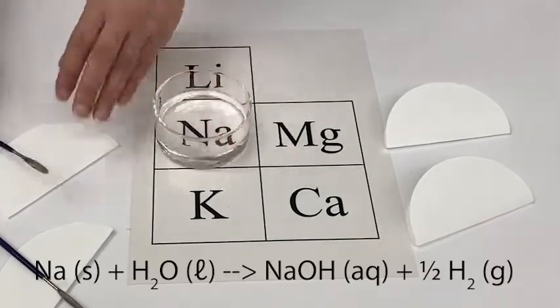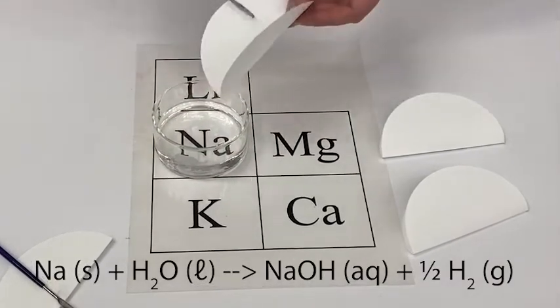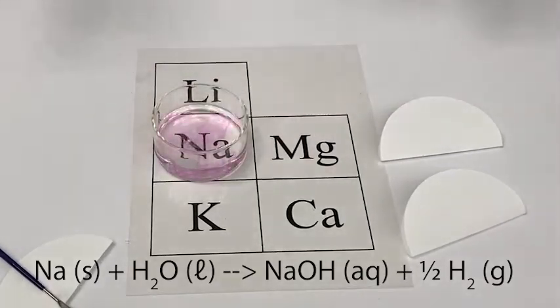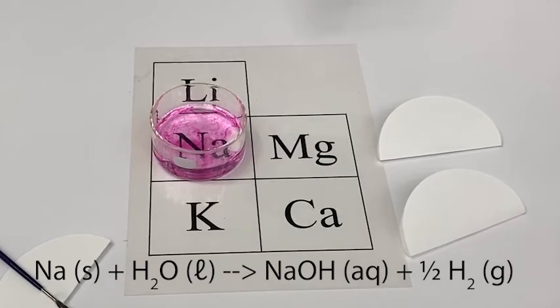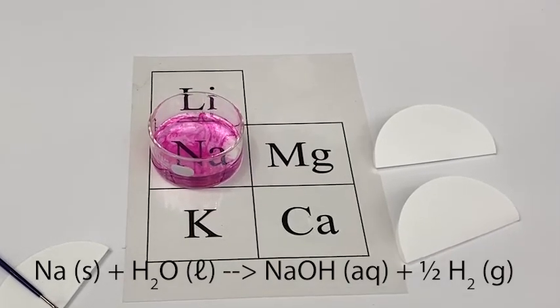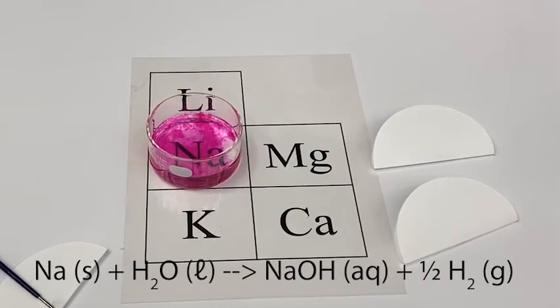Next, let's take a look at sodium. Do we expect sodium to be more or less reactive than lithium? Sodium is much more vigorous than lithium. You can hear the sizzling. Again, it produces a hydroxide, in this case sodium hydroxide, and hydrogen gas.